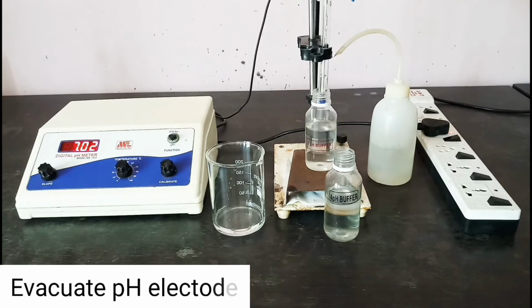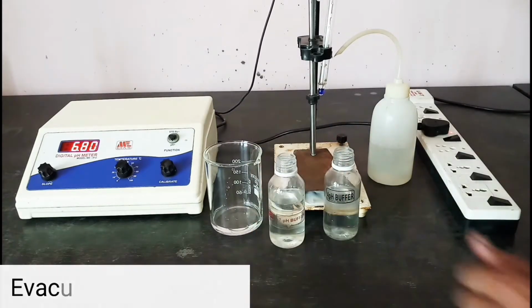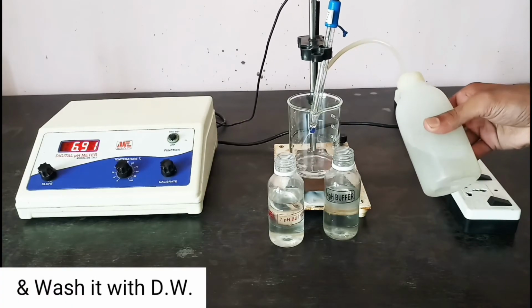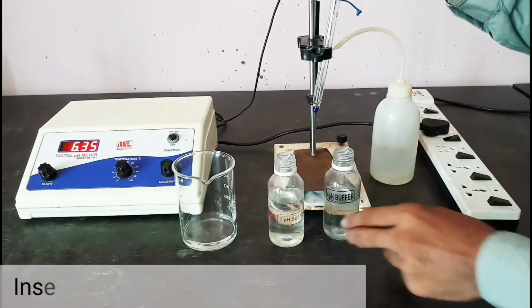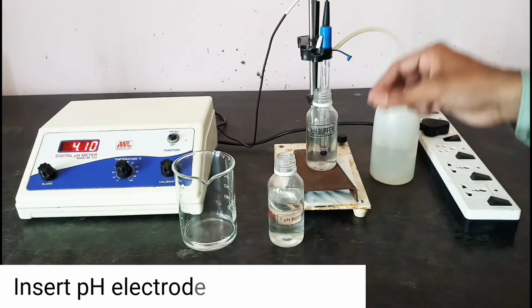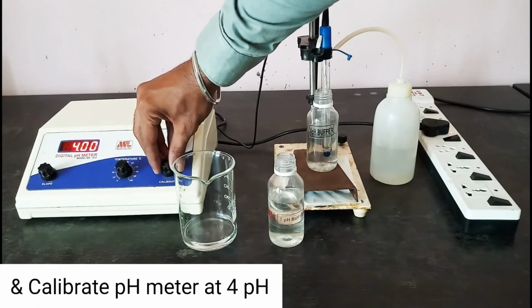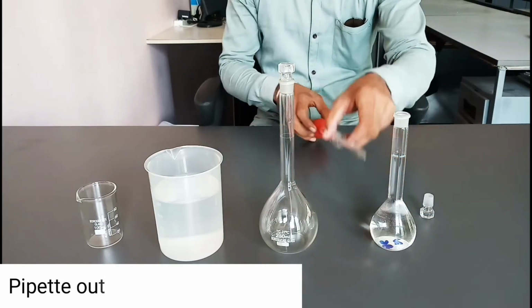Evacuate the pH electrode and wash it with distilled water. Now insert the pH electrode in 4 pH buffer and calibrate the pH meter at 4 pH. Now pipette out 25 ml unknown acetic acid solution.